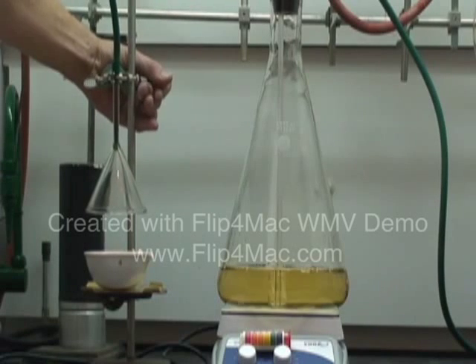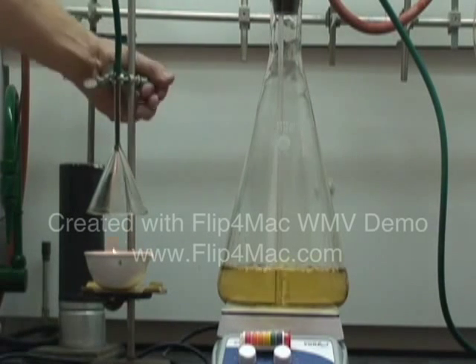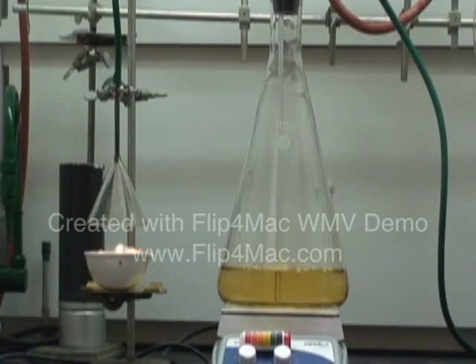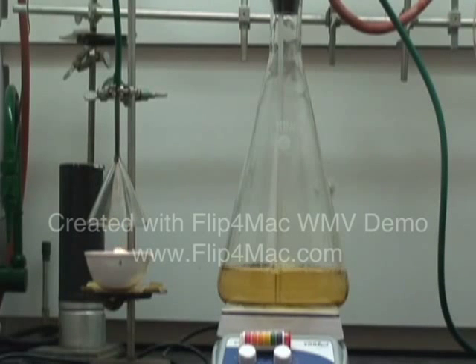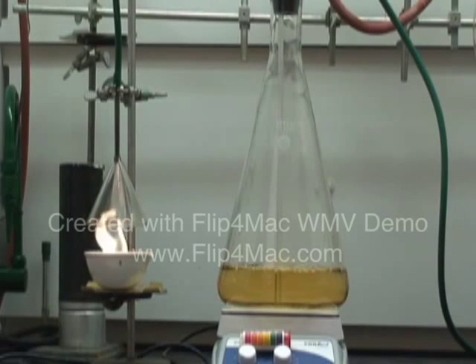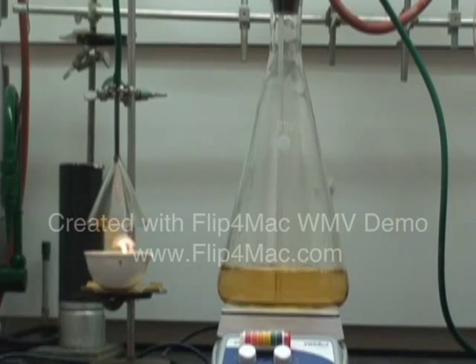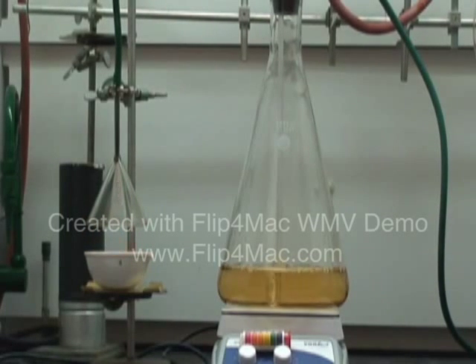the pH is again lowering, and again it is approaching a pH of approximately five, maybe a little bit higher than a pH of five.